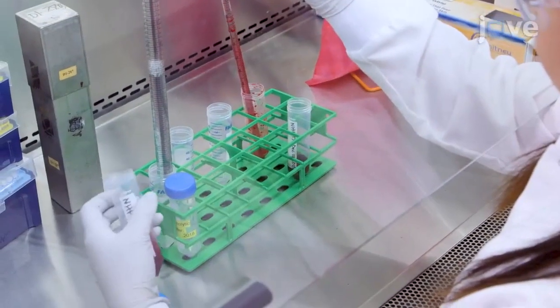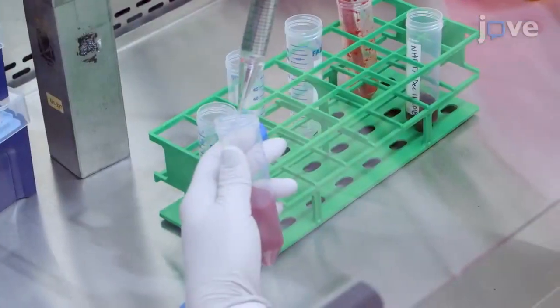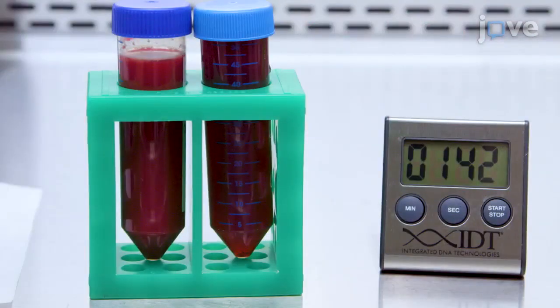Bring the volume of the tube up to 50 milliliters with hemolytic buffer and incubate the cells for up to 7 minutes at room temperature.